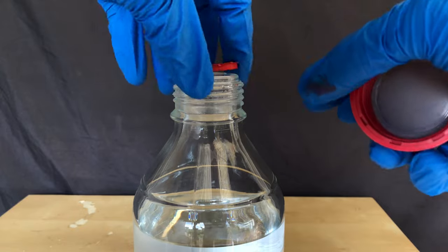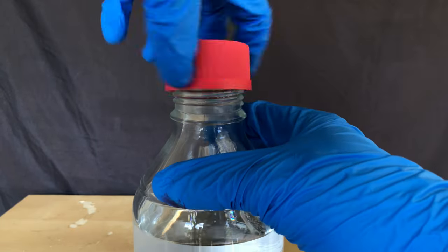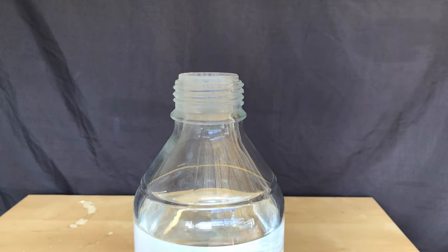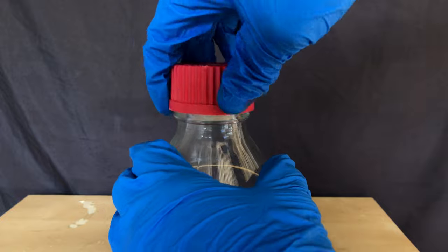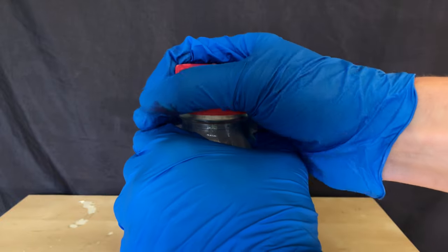I likely used way too much force, but unfortunately the cap of the bottle decided to break. Therefore I screwed on a new one. Acetyl chloride is pretty aggressive and I assume that it could have damaged the plastic over time.